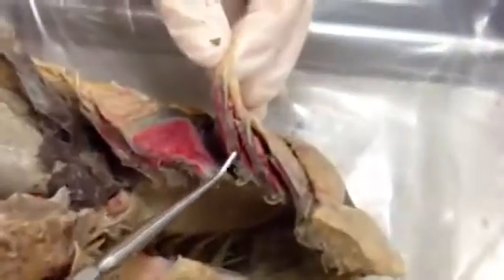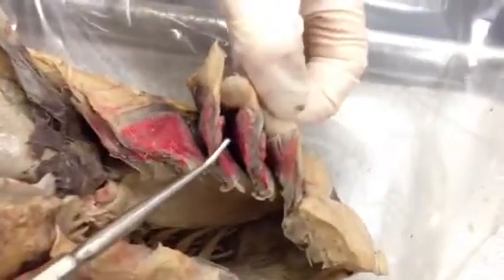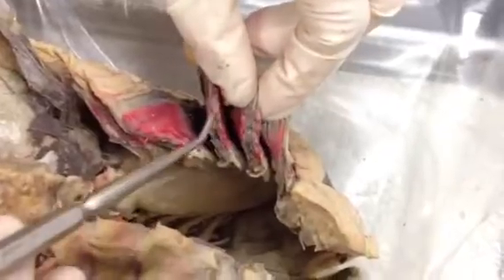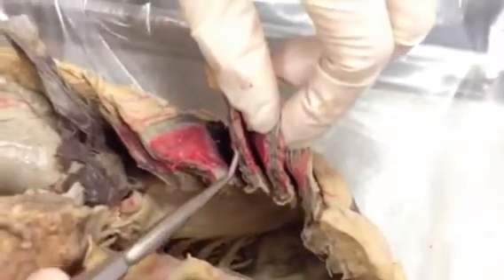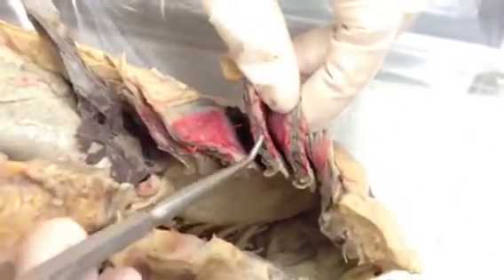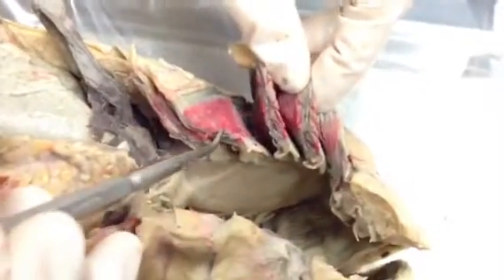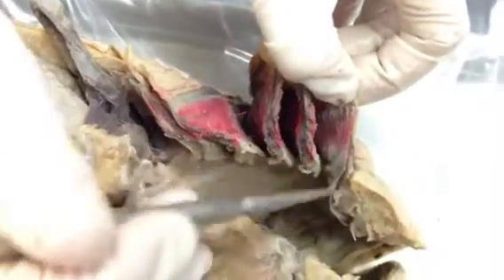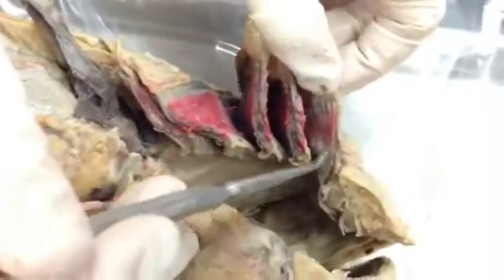There are different terms for which gills hold lamellae on the cranial and caudal side. For example, the gills that have lamellae on both sides are your holobranch gills, whereas the ones that only have it on one side — like this first one — are hemibranch.